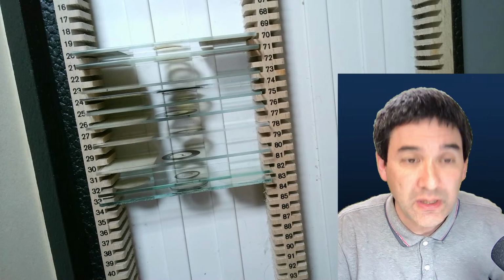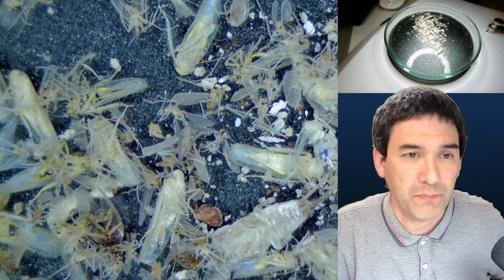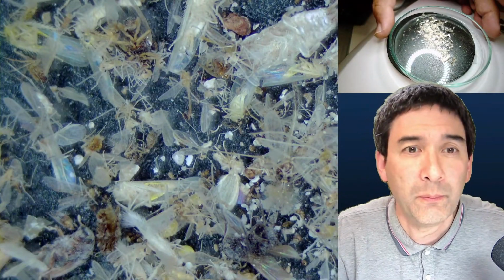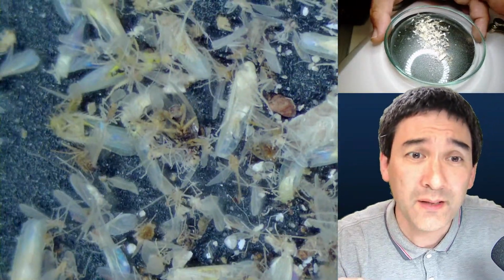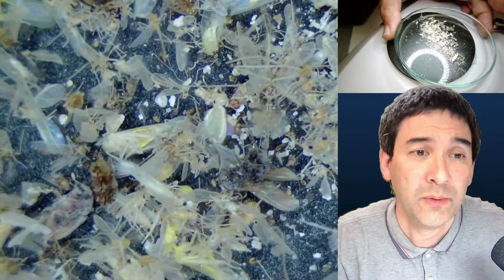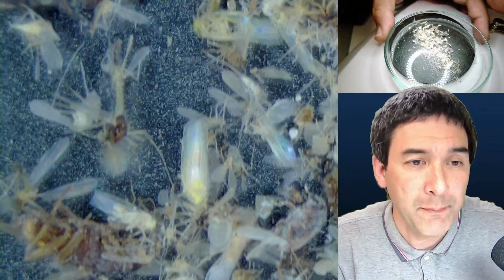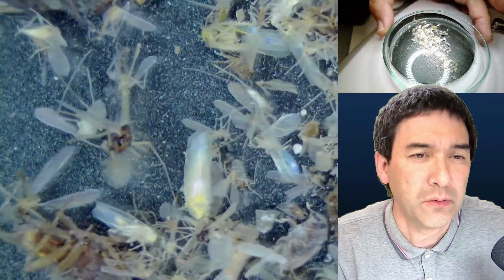So that's basically what I would like to do today, and I would like to quickly show you this picture over here. What you have here are these little insects that are collected from a lamp. I've got a lamp up there in my room. These insects found their way into the lamp because of the light, and basically they collected there, and they look pretty white. So apparently the bright light bleached them. They're very dry. I think it's almost impossible to mount. They don't particularly look very nice.